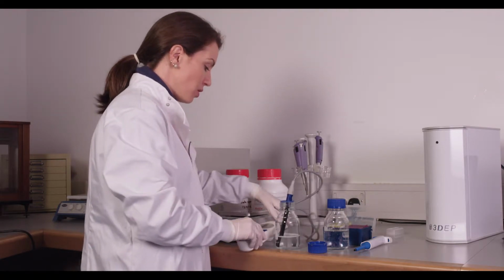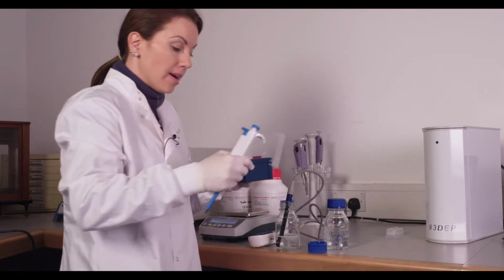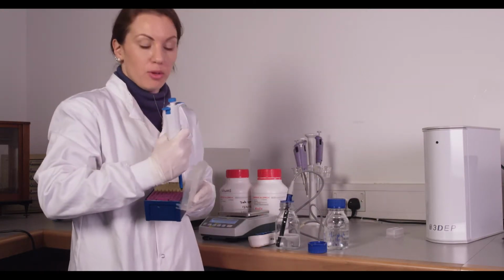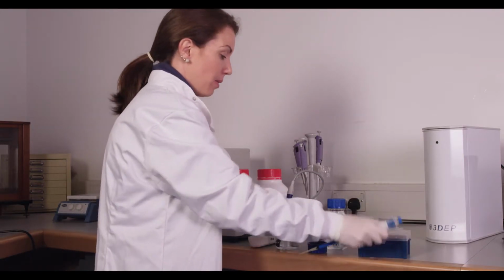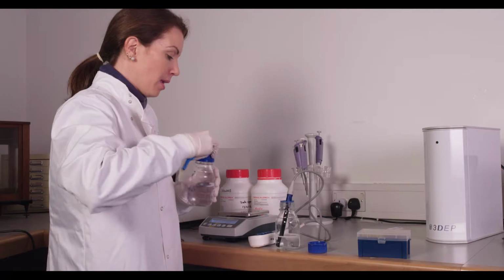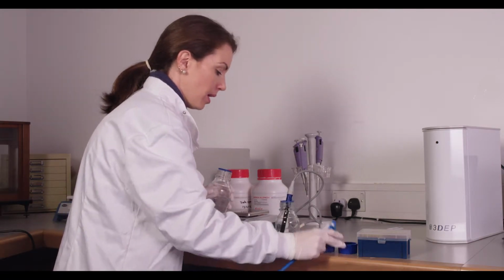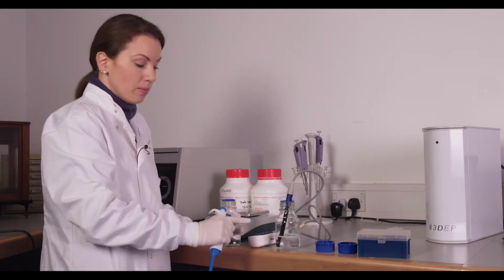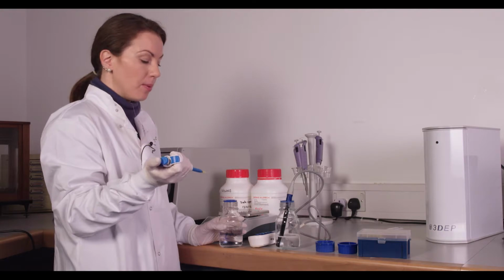And what you'll use to adjust the conductivity, typically we use PBS. Now this is PBS without calcium or magnesium. And you'll add little bits at a time of PBS to adjust the conductivity. Depending on your total volume, so in this case we're using 100 milliliters, will depend on how much PBS you add at a time.